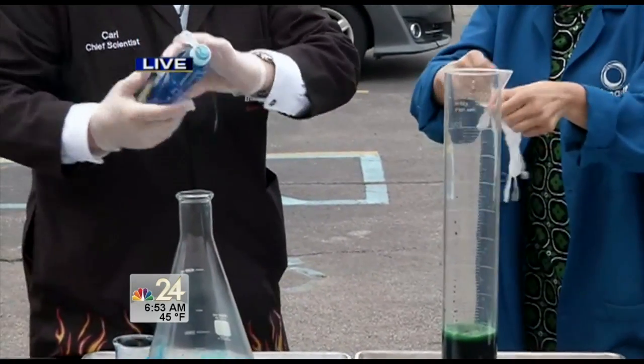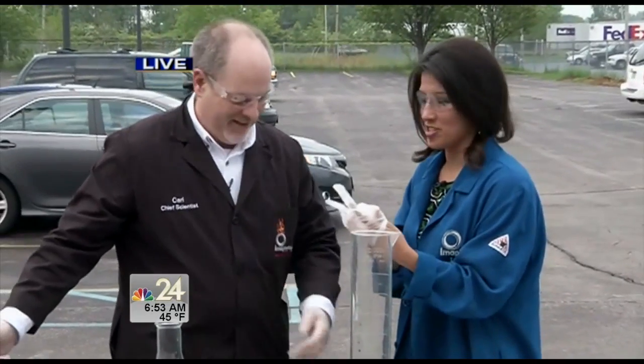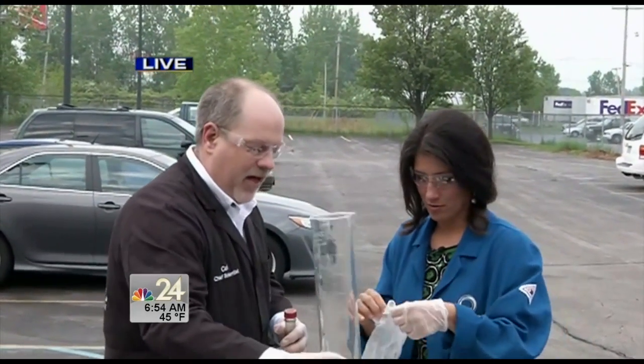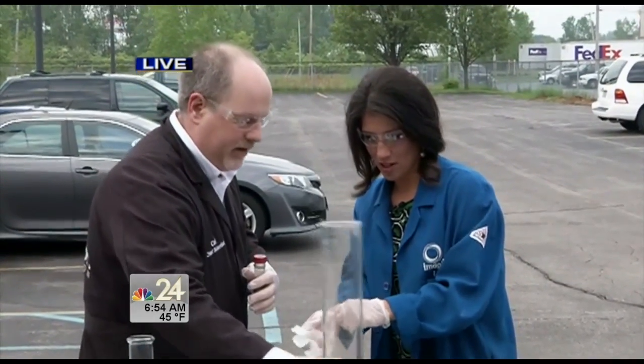You should put on some gloves — this is going to get messy because it's Super Splatter. Who doesn't love a little mess, unless you're in the kitchen or the living room? Right now, nothing is really happening that we can see.